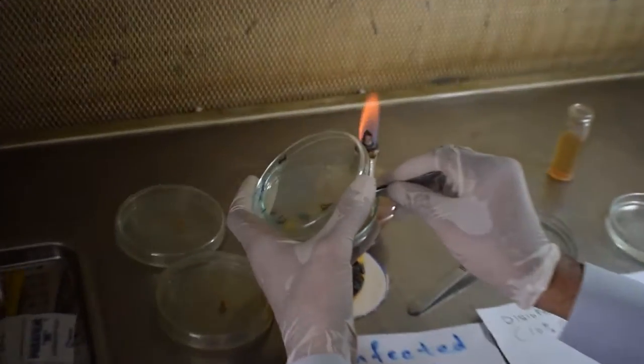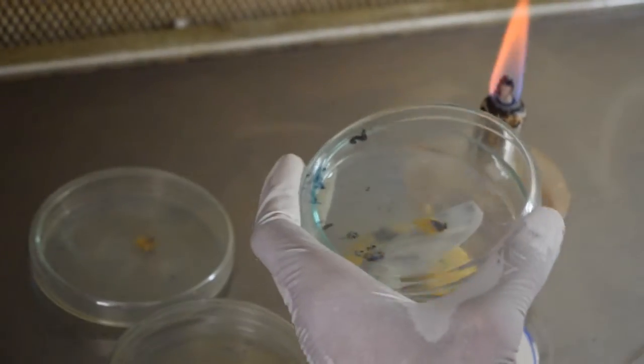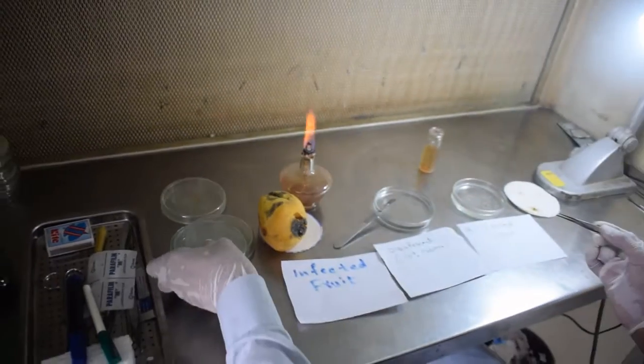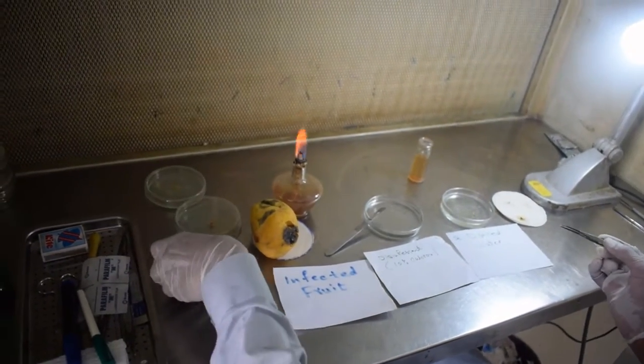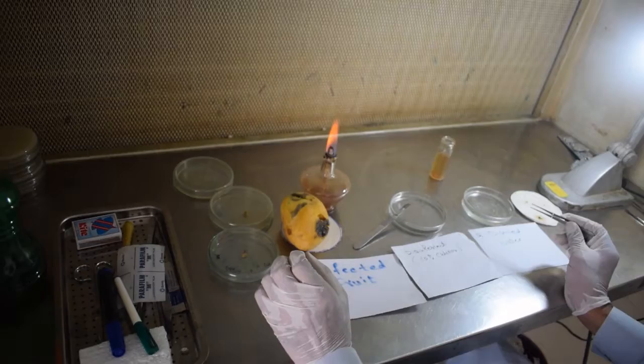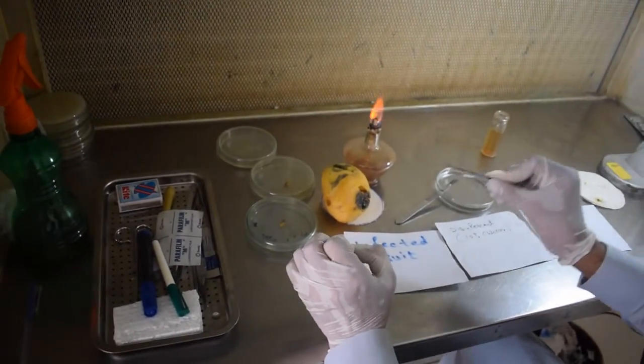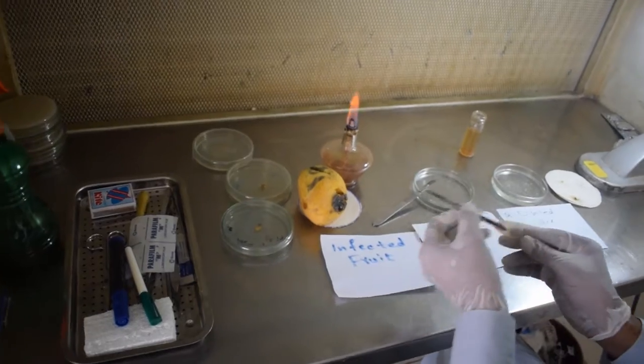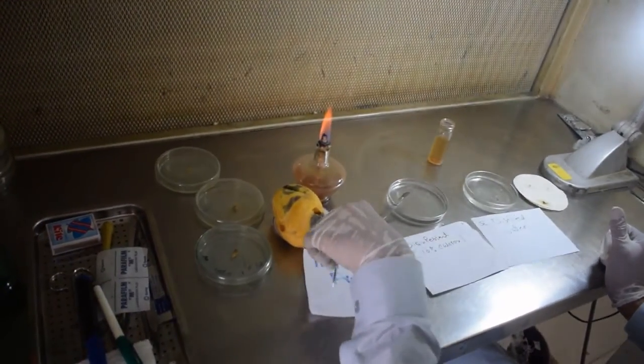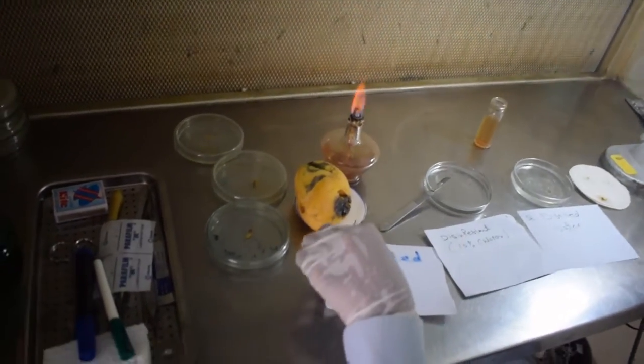So now I have placed these three infected plant pieces. These are three replications of the same sample, and we put them there. We may use the paraffin or we may not use it, no problem.